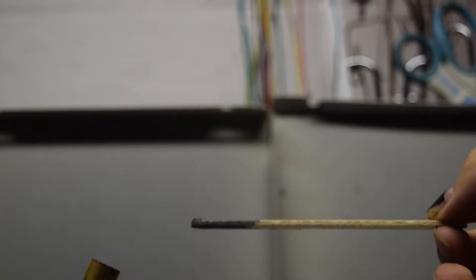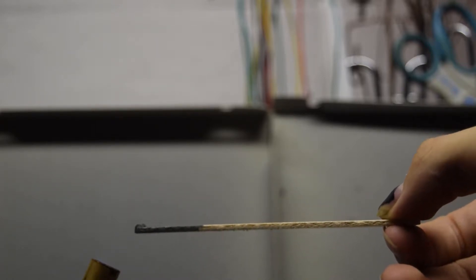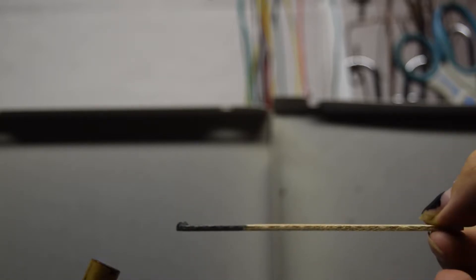For these first tests, I'm going to use the blowtorch and a popsicle stick that has the metal powder on it. First, I'm going to put the metal powder into the torch and let it spark a bit. And then once the popsicle stick lights, I'm going to pull it out and let that burn.